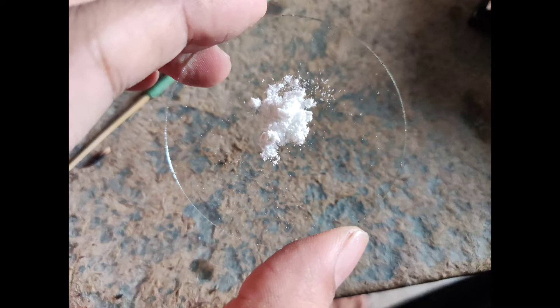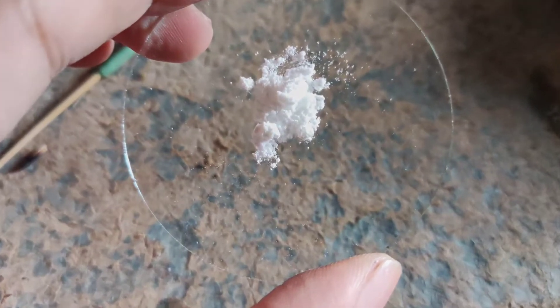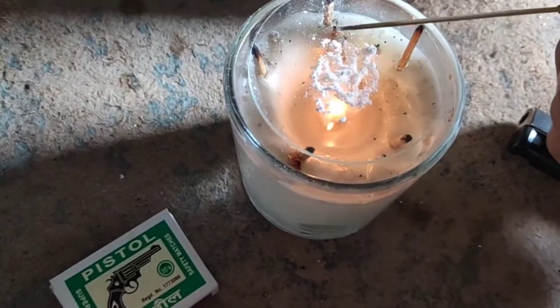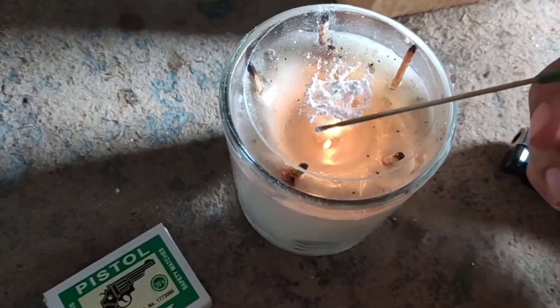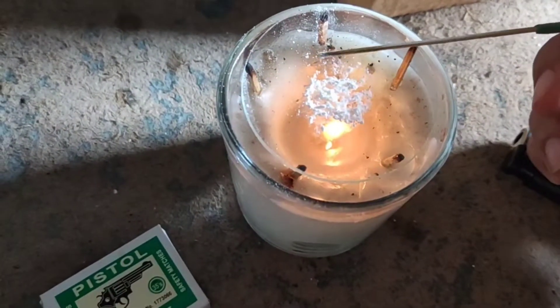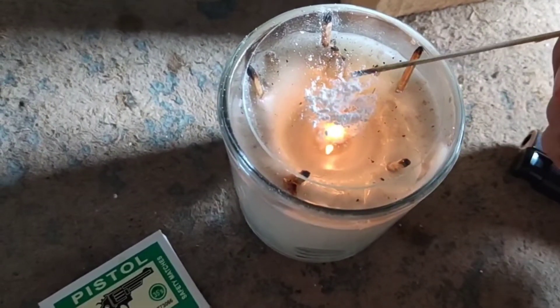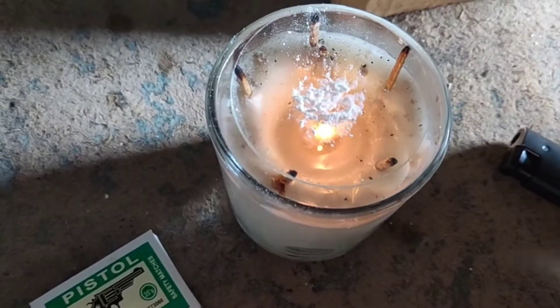Today I decided to convert caffeine anhydrous powder into caffeine crystals because I like the crystals, and crystals have sharp kinetics. There are many methods to do that, but I will be focusing mainly on two methods you can do at home. The first method is melt and cool — though it's actually not a melt, because caffeine has a sublimation point at 160–170°C and a melting point of 240–270°C. These kinetic points will change depending on which polymorph structure you're talking about and also depending on impurities in your caffeine.